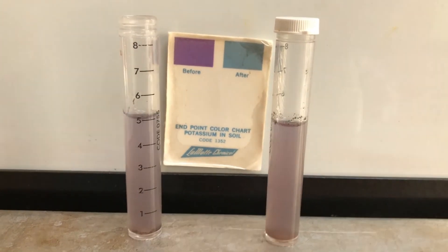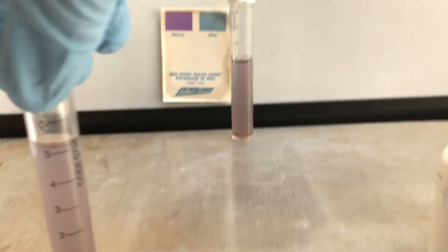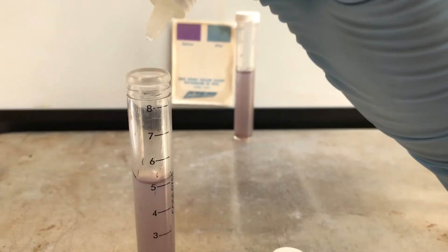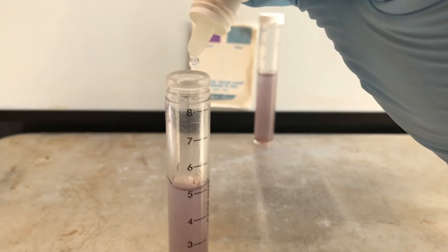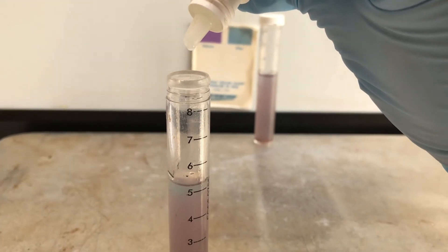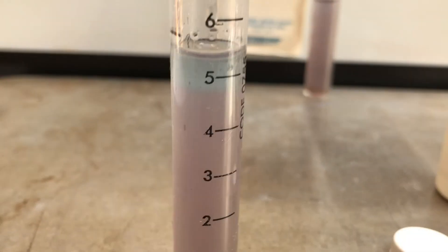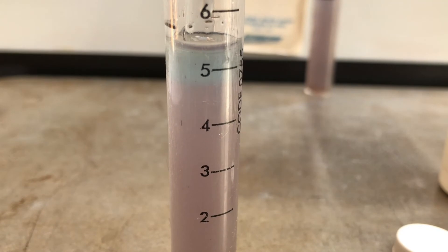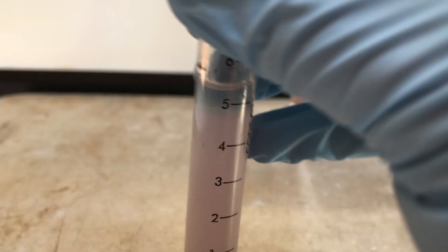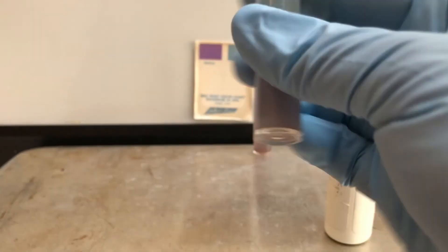So we're going to start by adding 9 drops to our vial. Let's bring this up close so we have a better shot at it. 1, 2, 3, 4, 5, 6, 7, 8, 9. You can see the top has already turned a bit blue. So what we need to do now is cap it and shake it. Let's just put the cap on like so and give it a little shake.